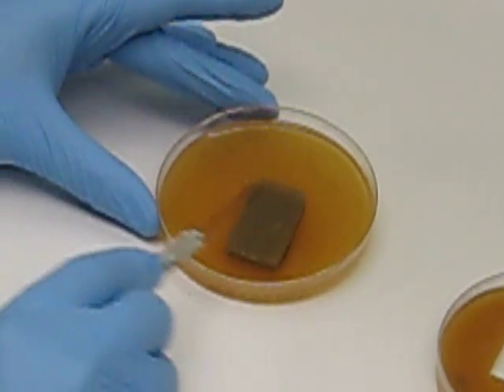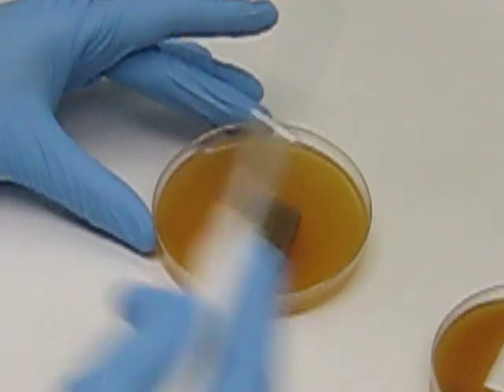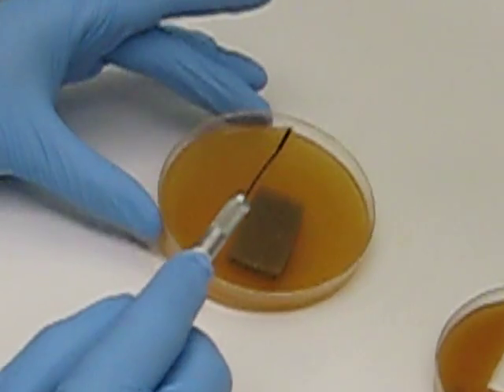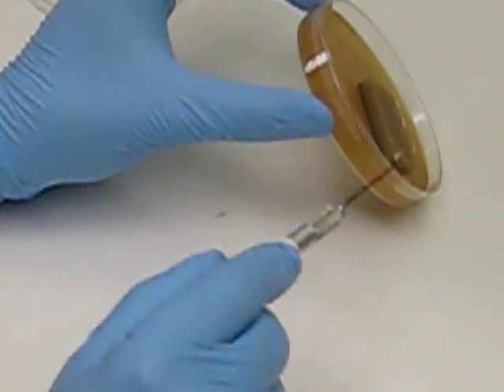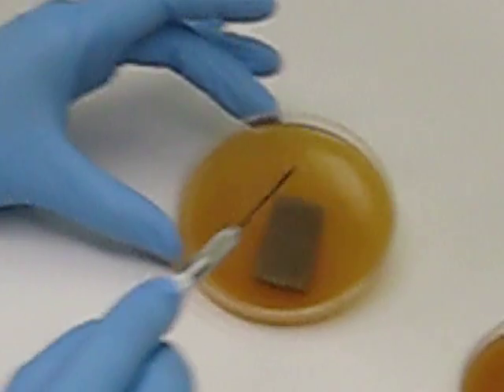During this process, I'm very careful not to touch the surface of the new media with my tool or anything else. Also, my fingers are not touching the rim of the petri dish. That will also vector contamination.